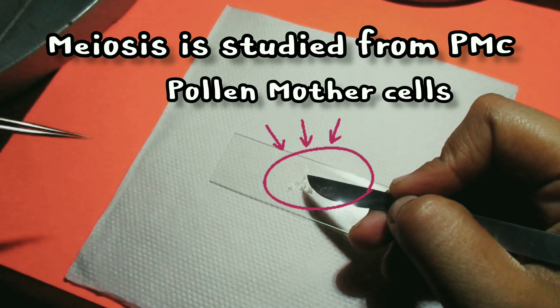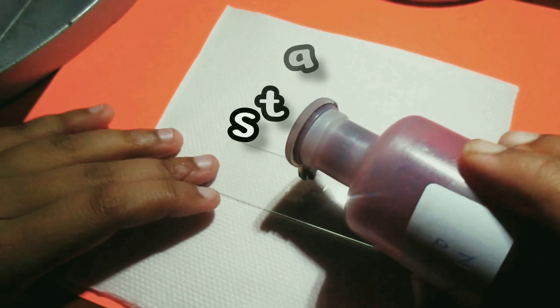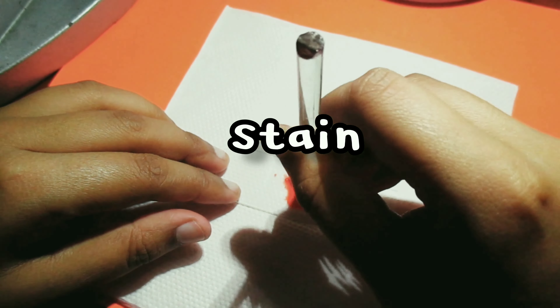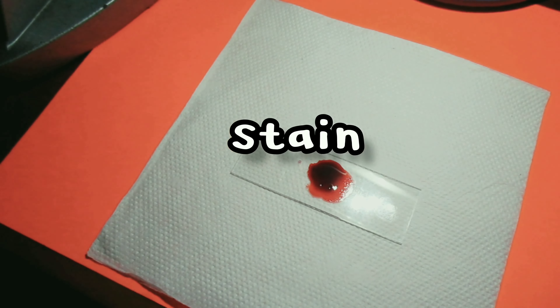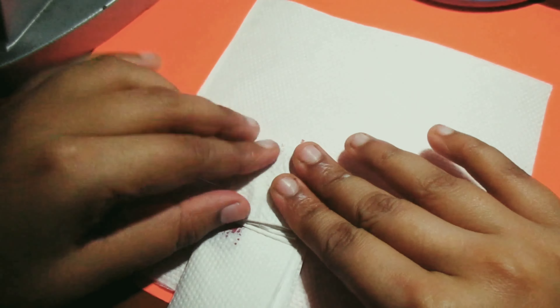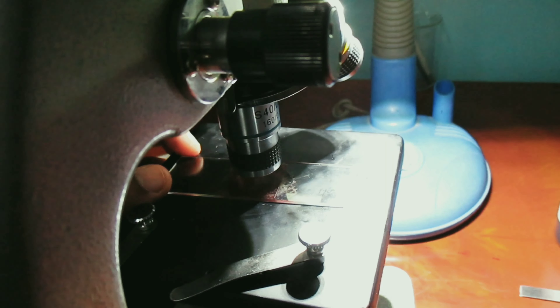Now I am going to take a flower bud of suitable size, dissect out two to three anthers with a needle and forceps, and transfer them onto a clean grease-free slide. I put one or two drops of one to two percent acetocarmine solution on them and gently press them with an iron scalpel or glass rod to squeeze out their content. Then I place the coverslip and tap it very gently to scatter the cells so that they form a single-layer smear, and finally observe under a microscope.